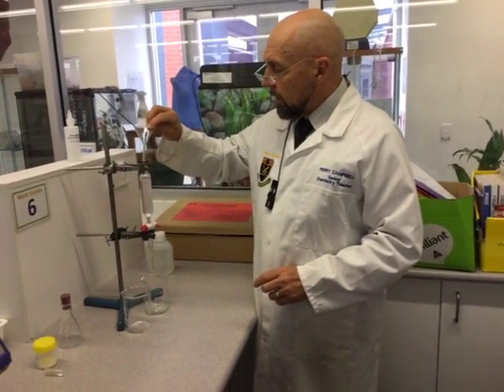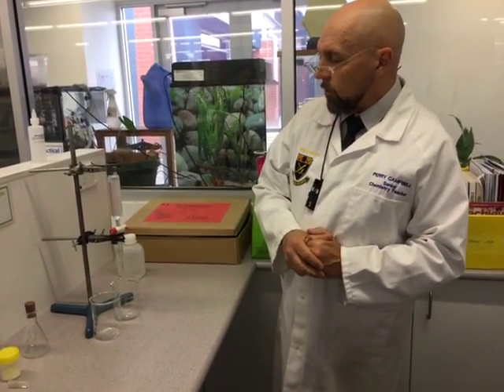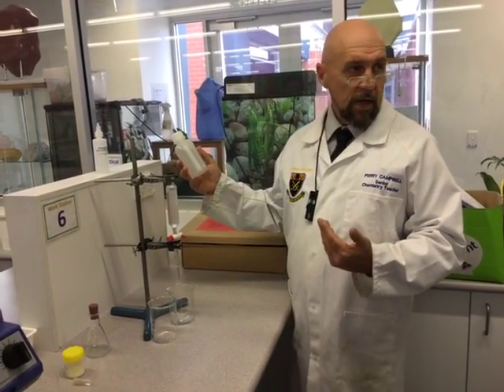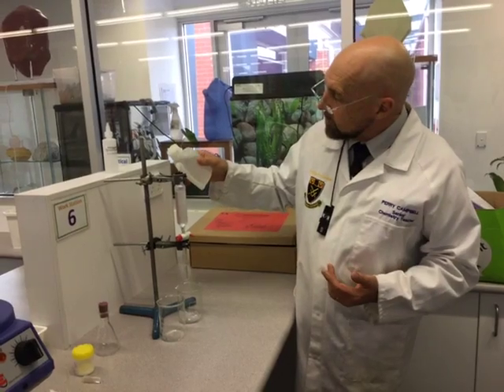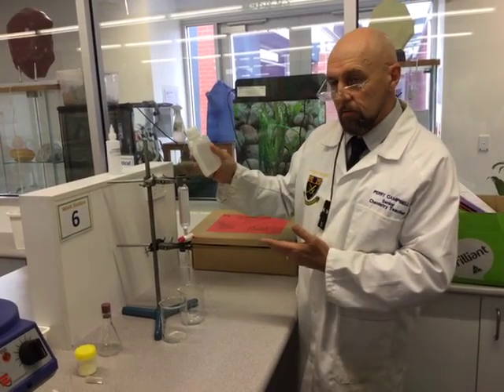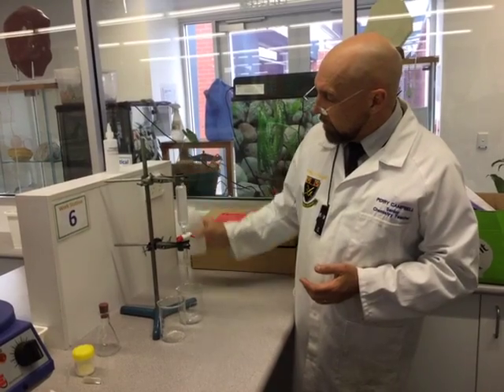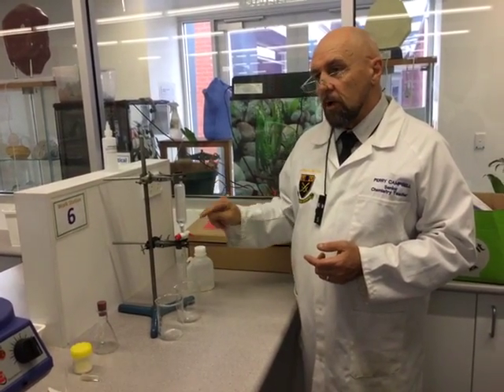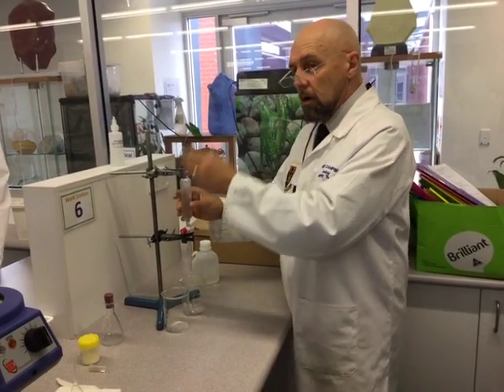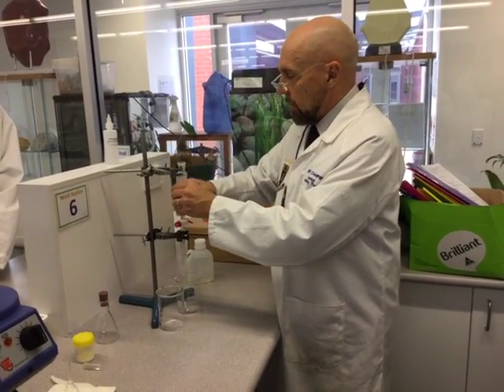What I've got here is my mixture of ester and the aqueous layer. A lot of people — the first thing they do — we don't know which is the aqueous layer and which is the organic layer. So I'm going to add some water. And where's the water going? To the bottom. The water's going to the bottom. So this tells me straight away that I've probably got most of my ester in the top layer, which is pretty good. It looks like a reasonable quantity of ester, though we don't know exactly at this point.